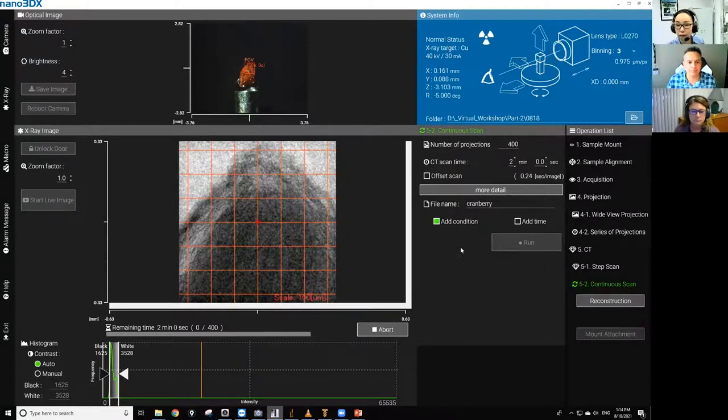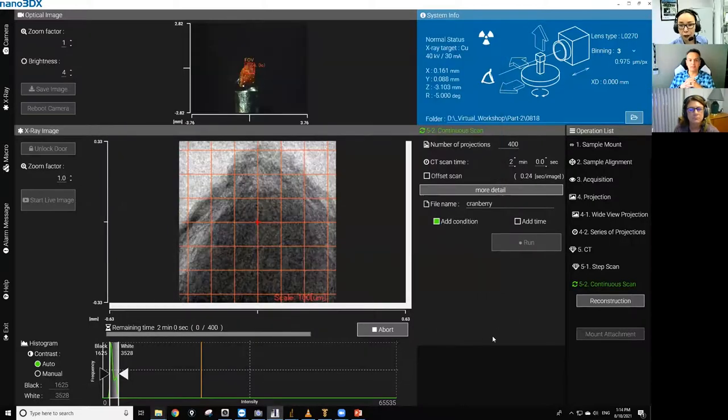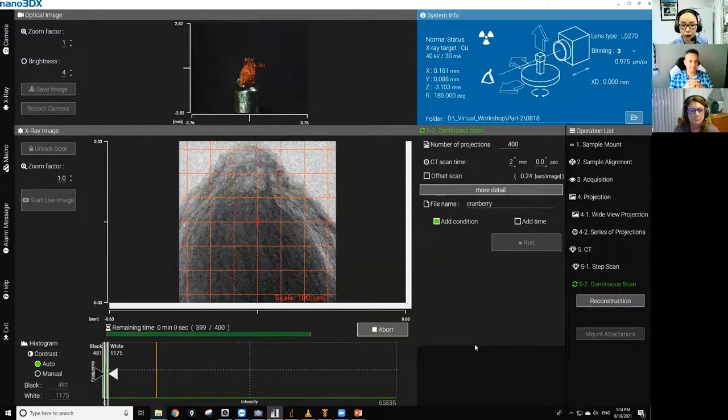building on that, and I think we'll talk about this a little bit later on, is the idea of feature size versus field of view, and how do you maximize your collection to get the best scan for the largest things? So we can talk a little bit about that as we go along. So that essentially comes down to, let me make sure one thing. Okay, so it is scanning. It's probably taking time to save the results because the scan is almost done. Okay, good. There you go. Now it went to 399. But anyway, while it's saving the file.